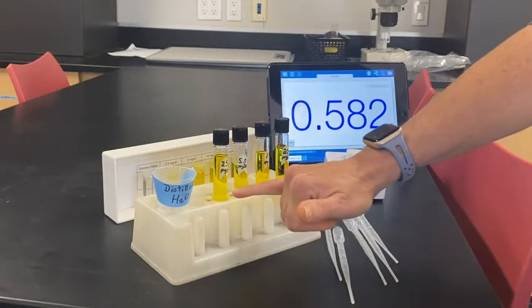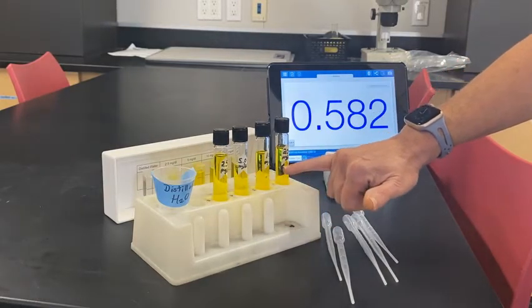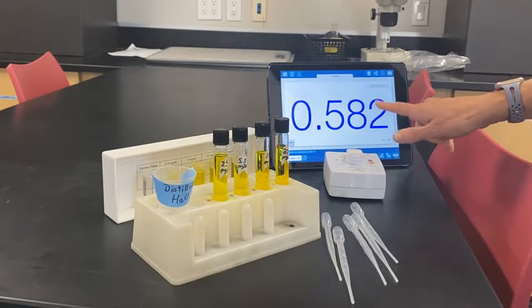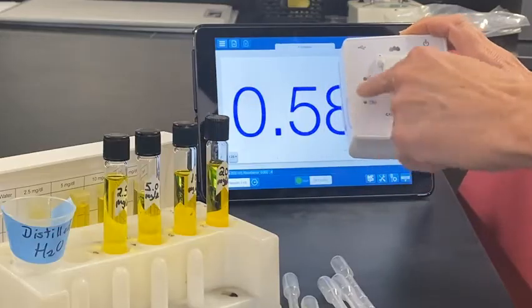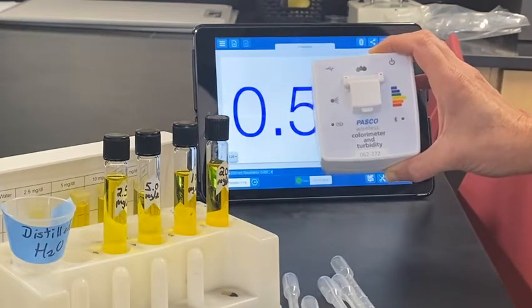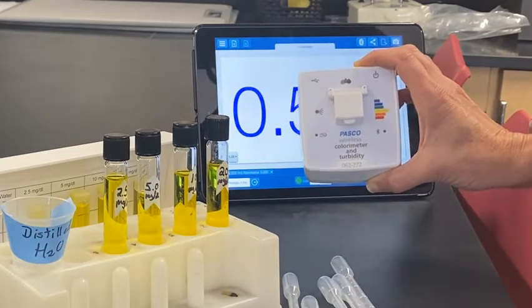You can see there is a slight variation in the yellow color. As more and more bilirubin is present in the serum, it should be a darker and darker color. We're going to measure something called absorbance using this colorimeter. The light — you can see the light bulb here — will shine through your sample and tell you how much of the color is being absorbed. The darker the color, the higher the amount of absorbance.